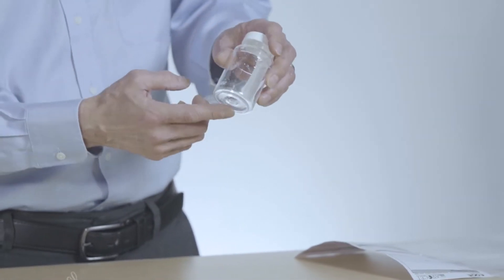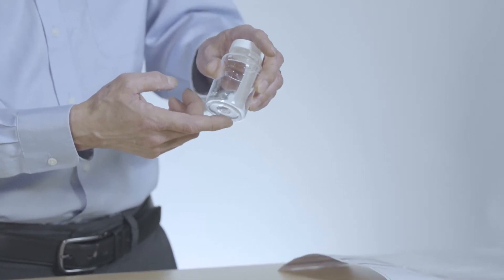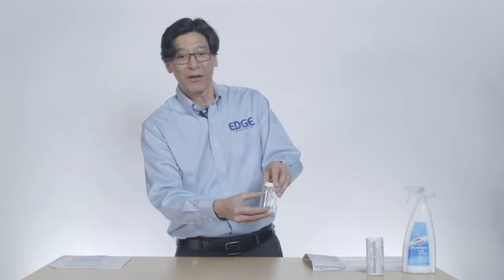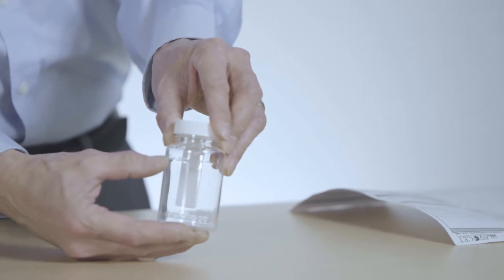Just on a side note, every once in a while this stuff will turn to liquid and you'll find a bottle that looks like it has liquid to begin with. Do not be alarmed. Everything will be okay. That is just a preservative. But the important thing here is we want to fill this bottle to the 100 mil mark, and we might want to have it just slightly above that because we don't want it below.